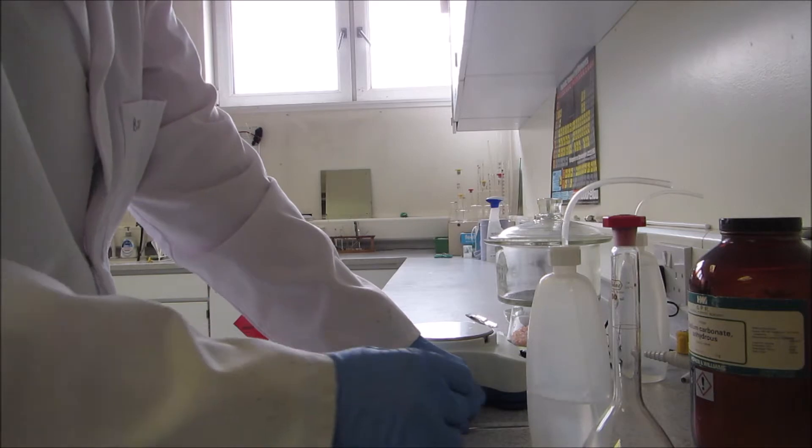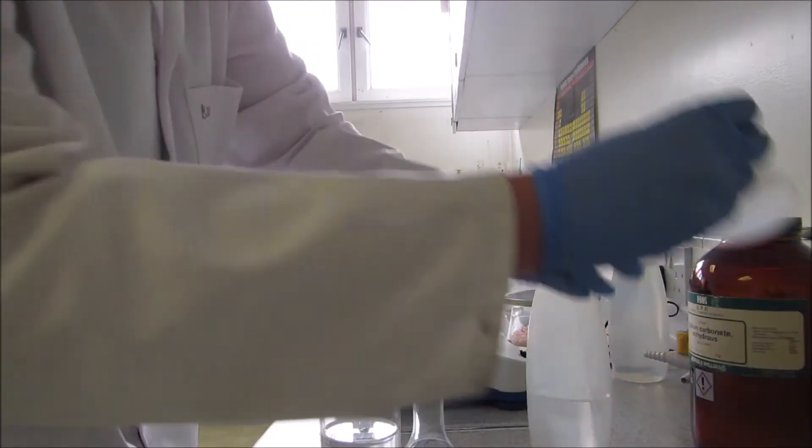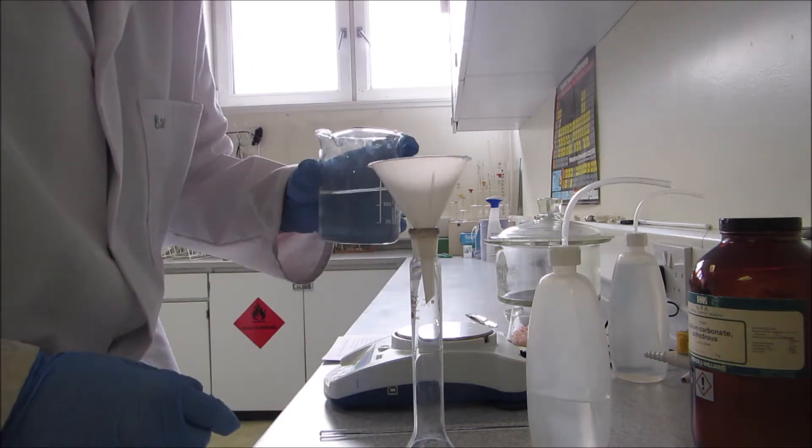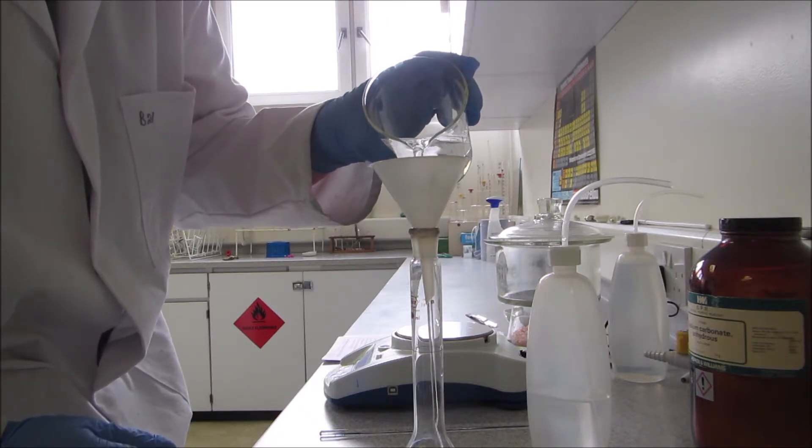Now I'm going to take my volumetric flask and put a funnel in. Give it a little swirl with your hand to mix it and just gradually pour it into your volumetric flask.